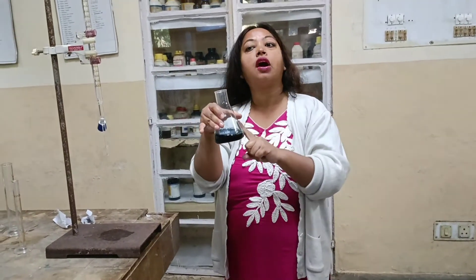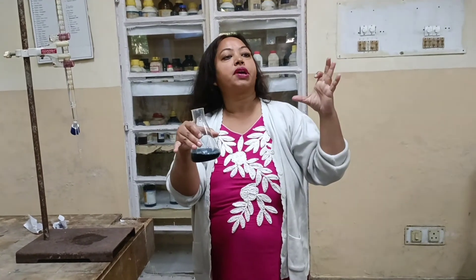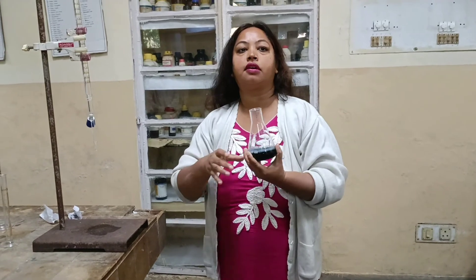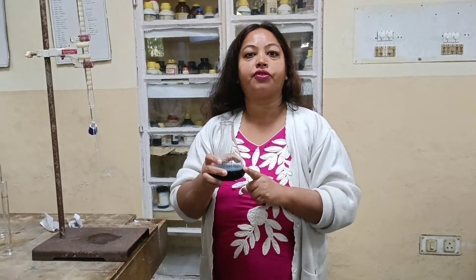That's why it is giving a sharp blue colour — because it has reacted with the metal, the metal has become free, and we have got a beautiful blue colour. Magnesium sulfate is added in this titration to give you the sharp end point. Thank you so much for watching.